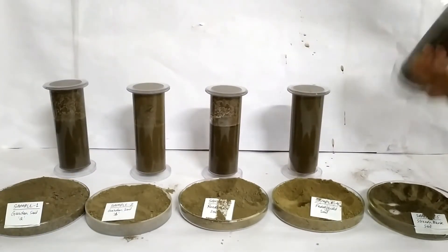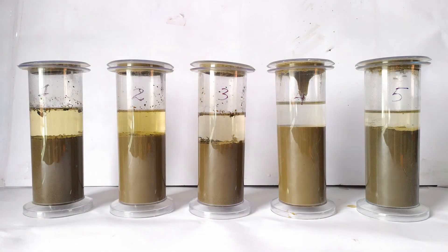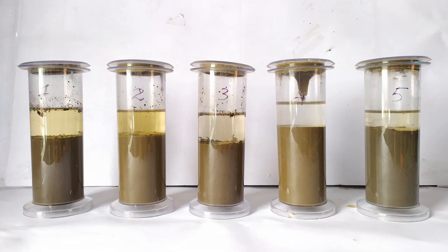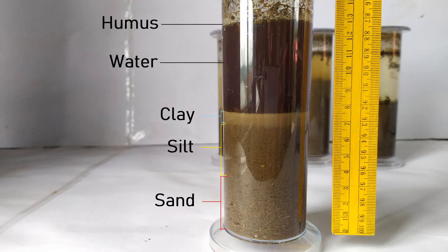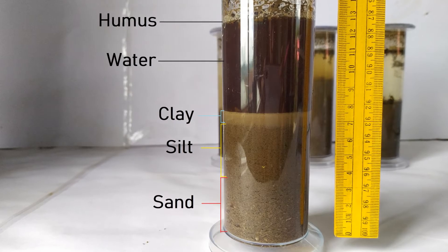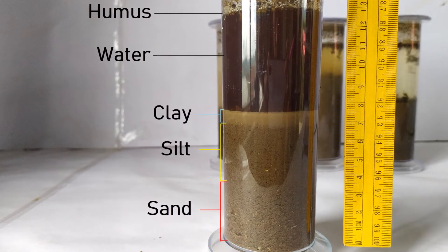For accurate results, it is recommended that the soil particles be allowed to settle for at least 24 hours. After settling, observe the soil samples in each container. The sand, silt, and clay layers would have separated into different strata in descending order of size — the bottom has larger sand particles, followed by smaller silt particles, and finally a layer of fine clay particles at the top. You can also find a layer of dead organic matter or humus floating on the surface of the water.